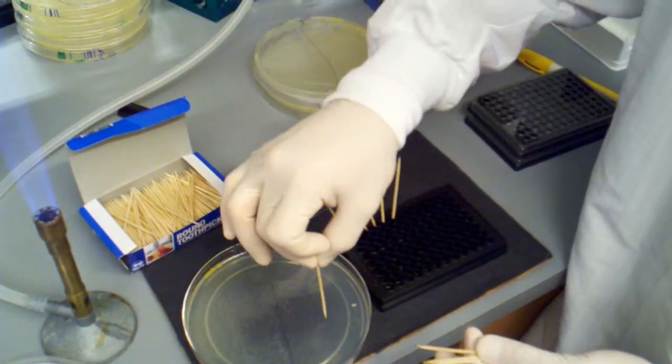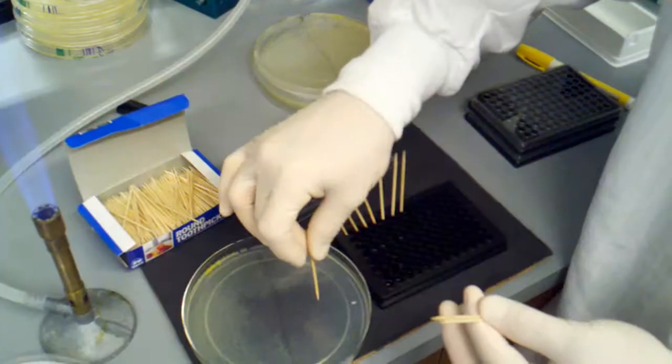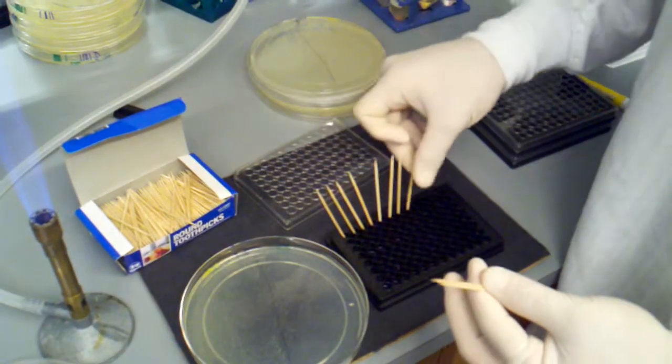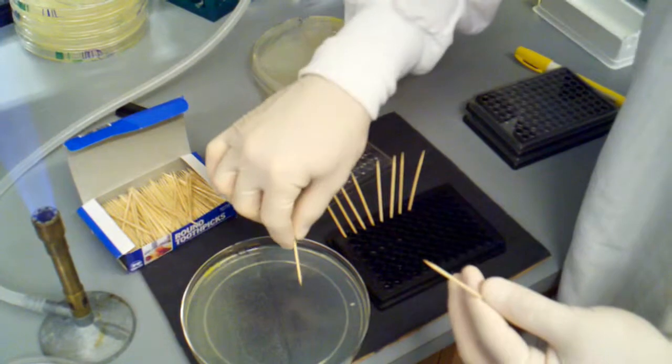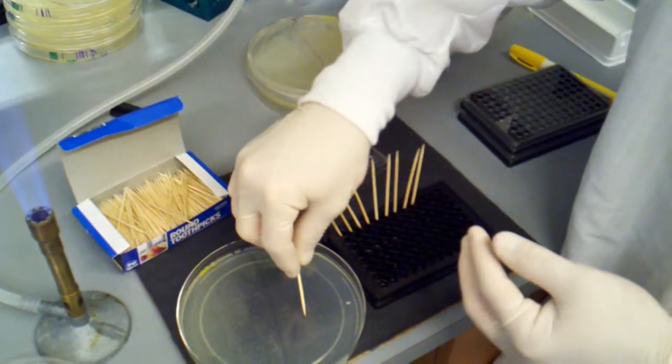Alright, so I'll just pick four more. And three, well that's two, three, and four.